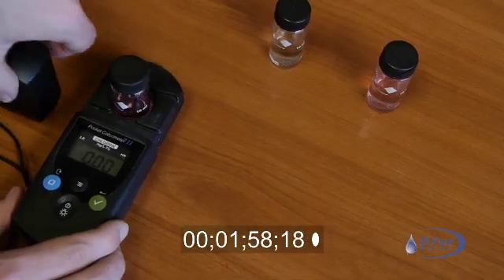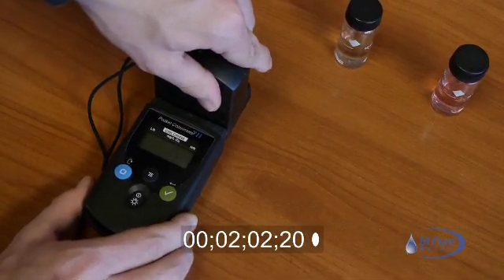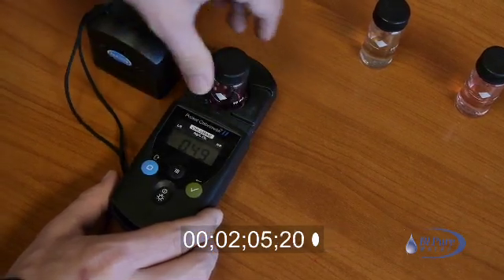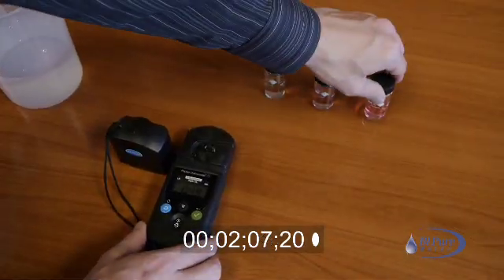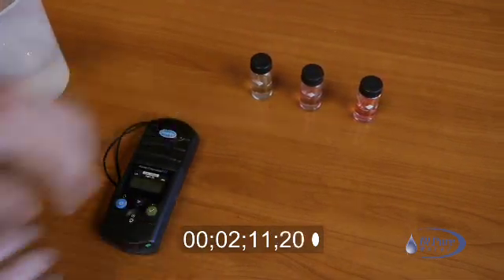Put the measurement cap on and press the measurement button again. The free chlorine sample can now be removed from the instrument. You are now done with chlorine testing.